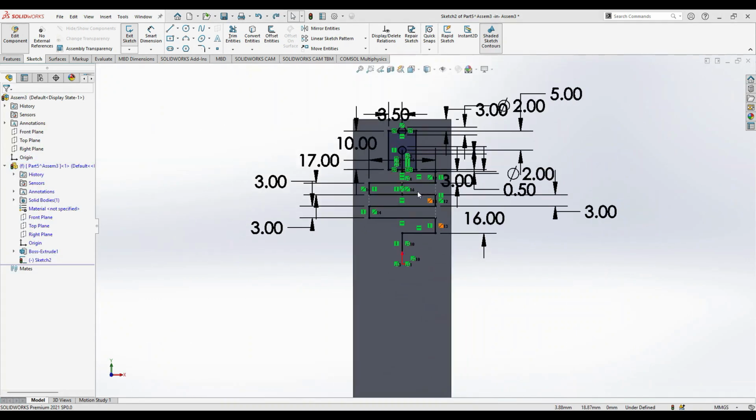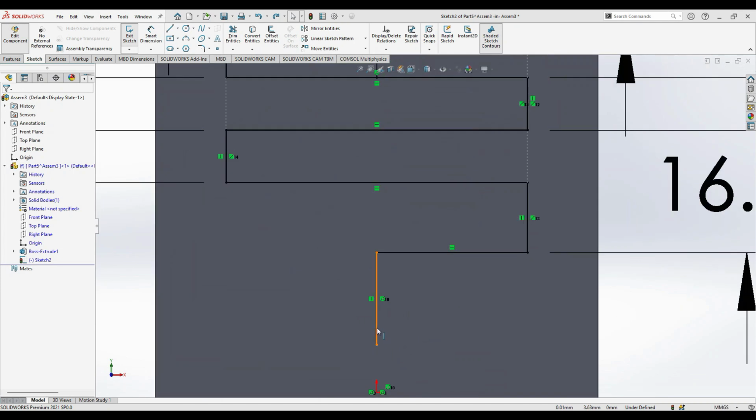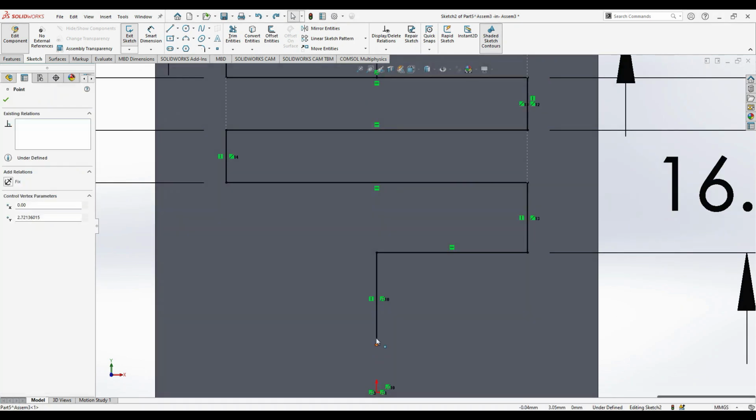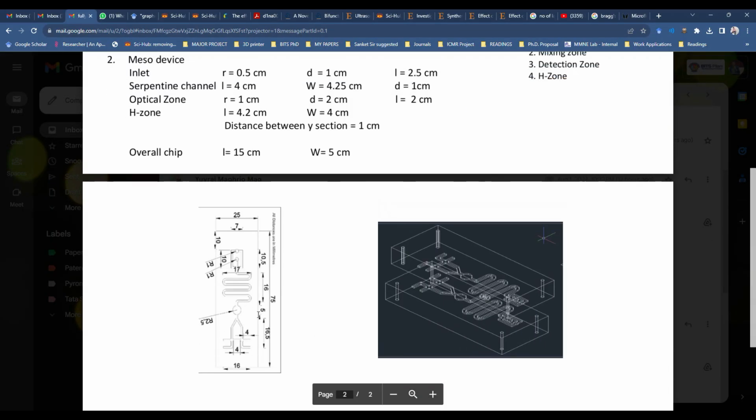So now the sketch is fully defined, but however we have this thing that is not defined, so that is the reason it is showing underdefined. We'll go back to the sketch and we can see this. So the overall length is 5 and a radius of 2.5. So we can create it.